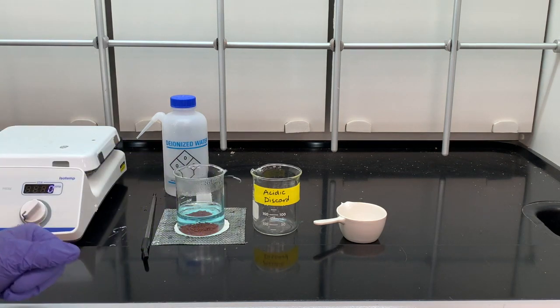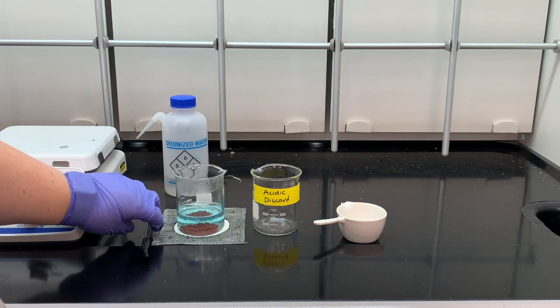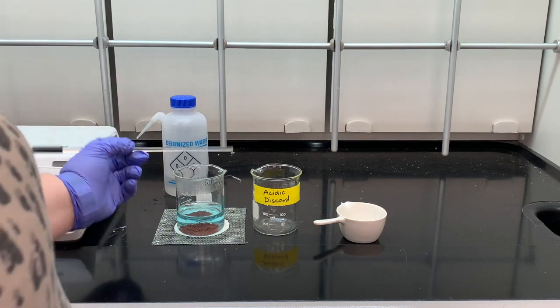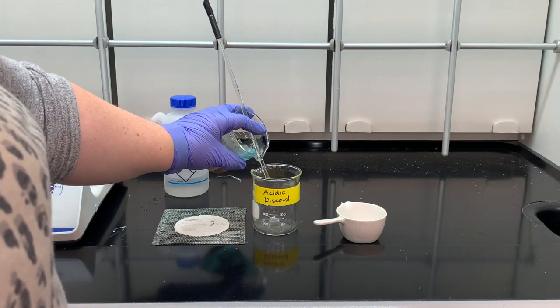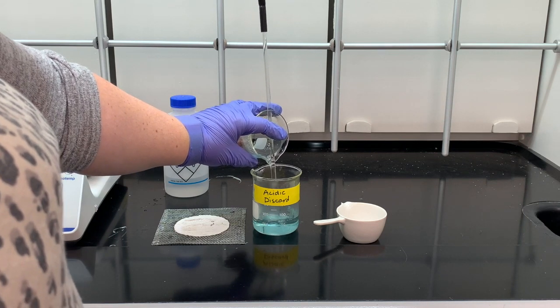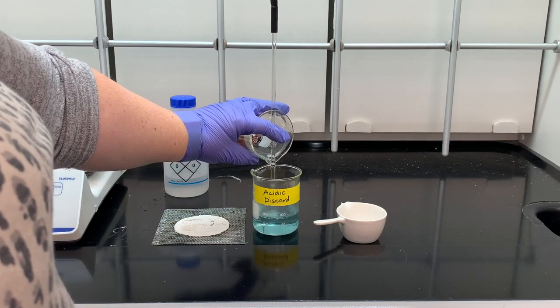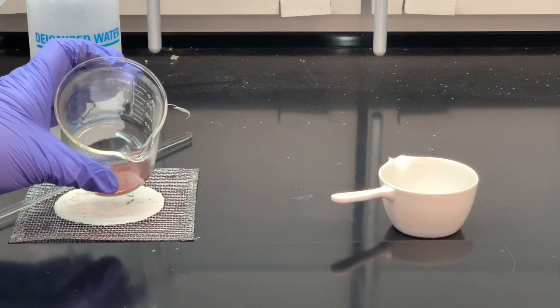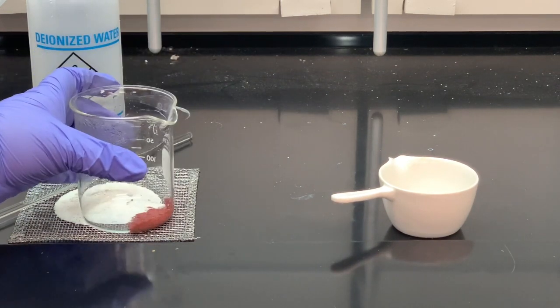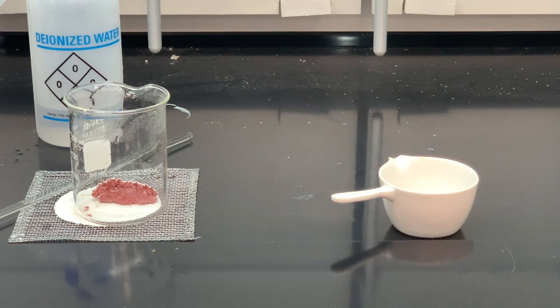We are ready to decant. We want to pour the liquid off of our copper into the acidic waste container. I'm going to use my stirring rod placed into the spout of my beaker and then carefully pour off the liquid, slowly enough that I don't pour out any of my solid. The solid is now the copper, so we want to recover as much as possible. Now is also a good time to fish out the boiling stone — that white piece in the beaker — because we don't need that anymore.